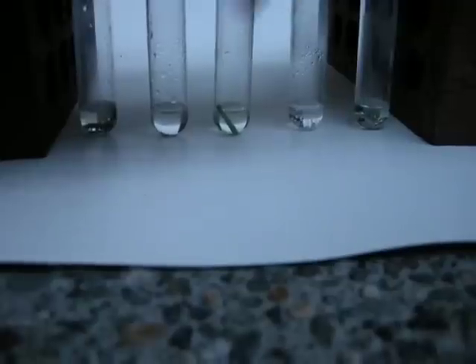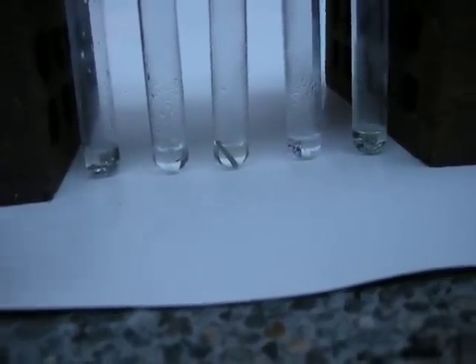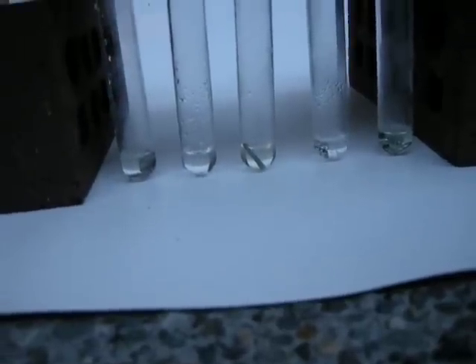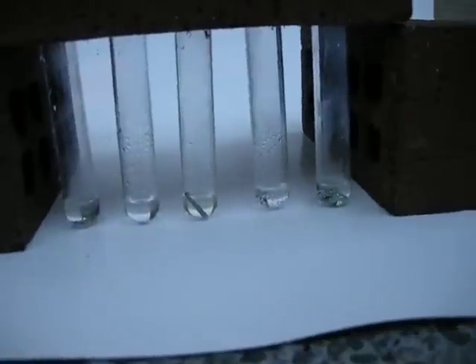This one with the galvanized steel has taken on a yellow tint. I'm wondering if that has anything to do with using yellow zinc, but hopefully not. Though it is an old piece of wire, so you never know.